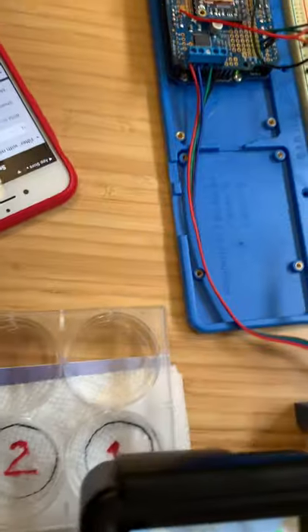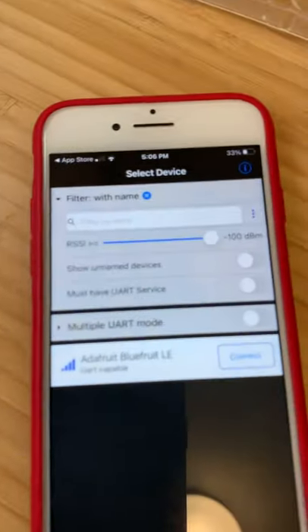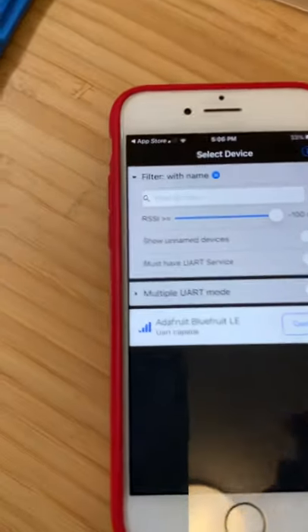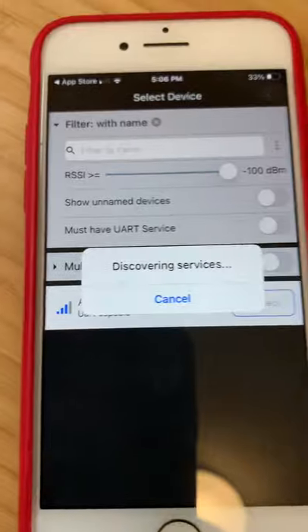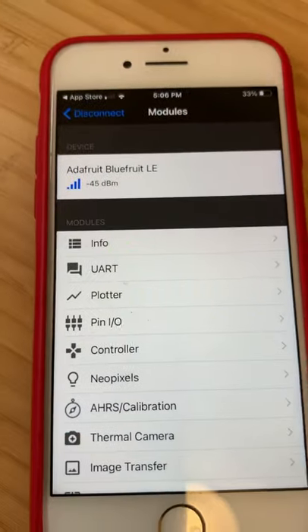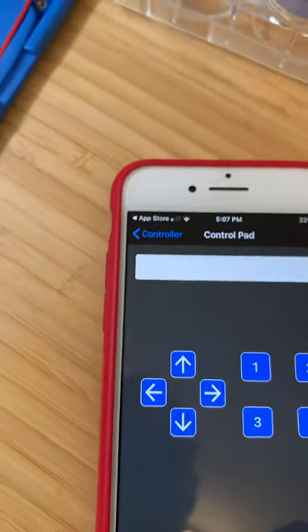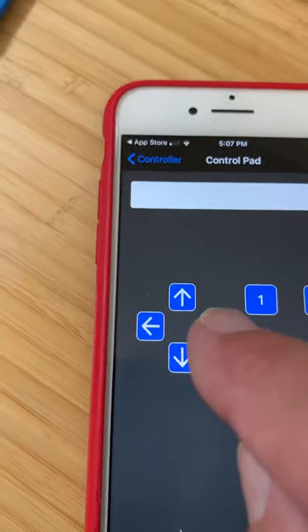Okay, and so what we're going to do is now go in here to the Bluetooth interface application on the phone, and we will go in and connect to the Bluetooth. There we are. And now we're going to go in and select controller, and we're going to select control pad, and what I'll do is go in and click forward.